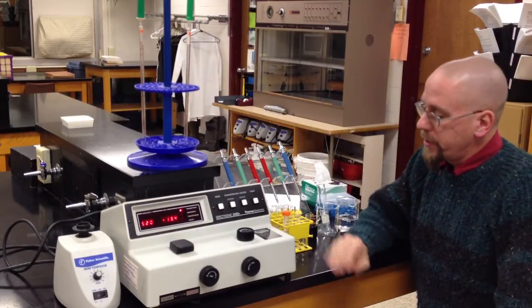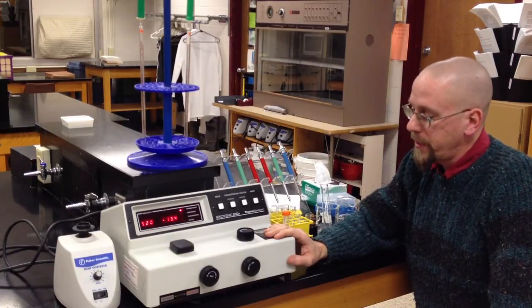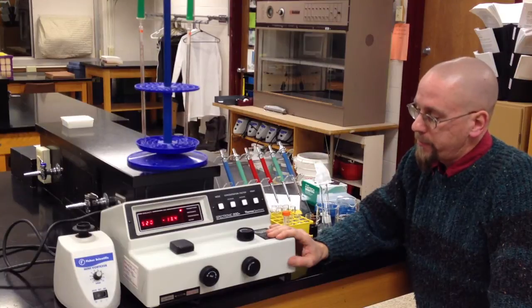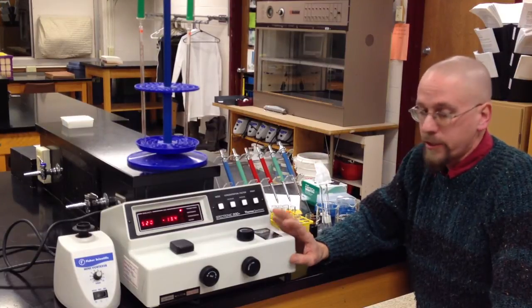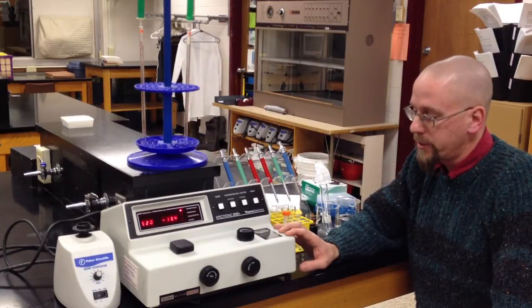For this, we're going to need a spectrophotometer. This is a Spectronic 20D Plus digital spectrophotometer. You're going to get very familiar with this instrument. I'll give you a little overview of how we get started and what it does.